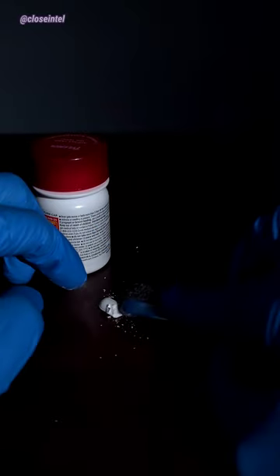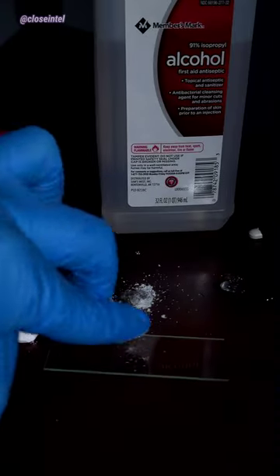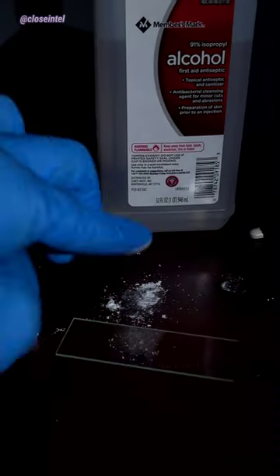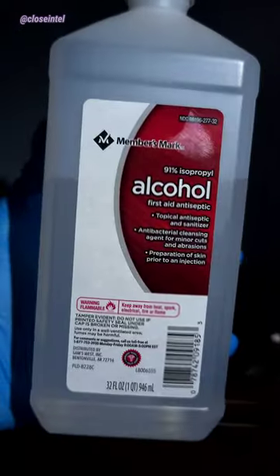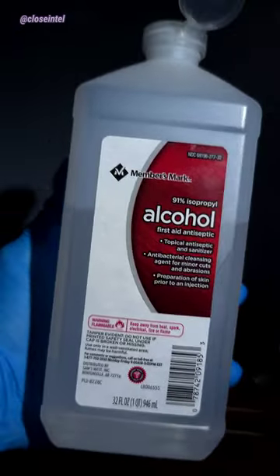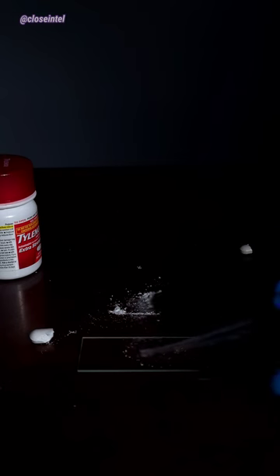We don't need the entire capsule, so I'm going to crush one of them up into a fine powder and sprinkle it onto a slide. I then just need to add a small amount of 91% isopropyl alcohol and allow it to dry.